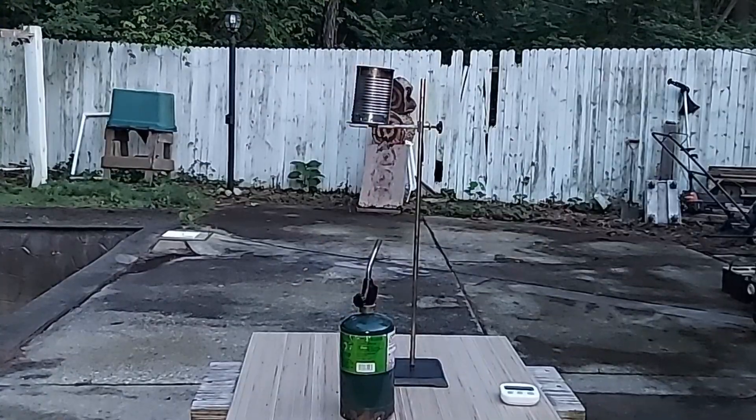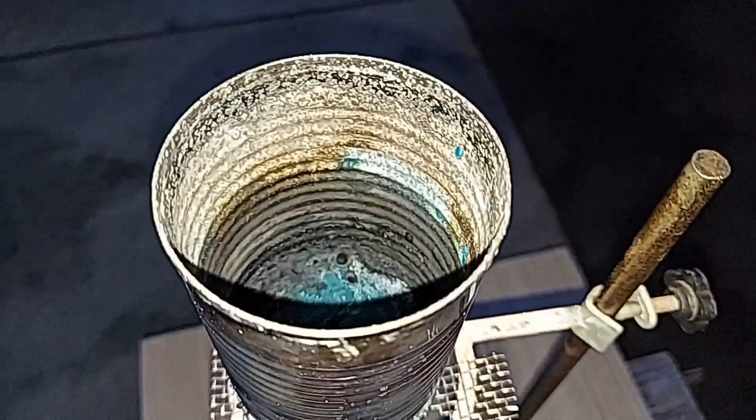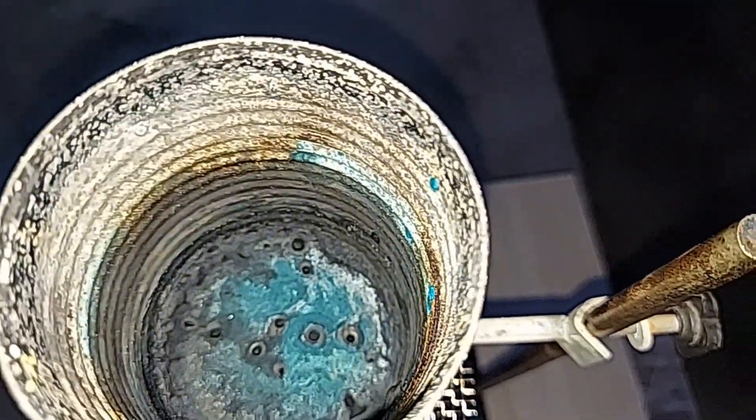Okay, it's done. I'm just letting it cool now until we go to the next step. It's still cooling down, but I just want to show you the inside right there. That's production of a lot of manganate in there.